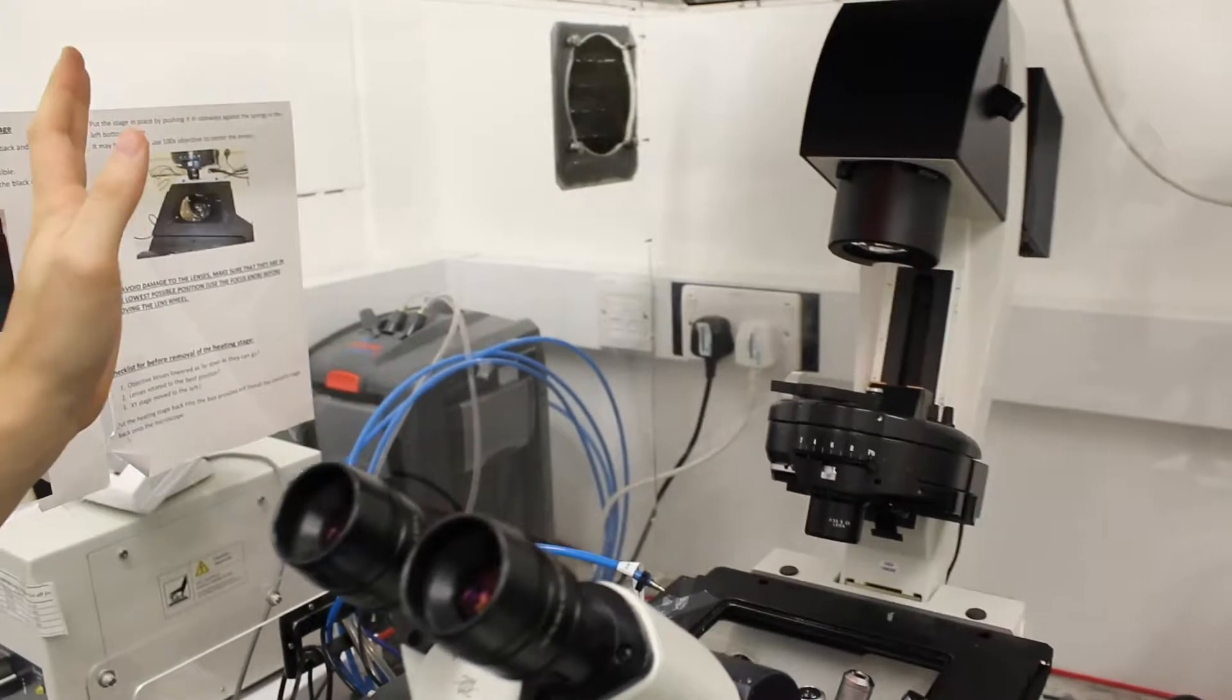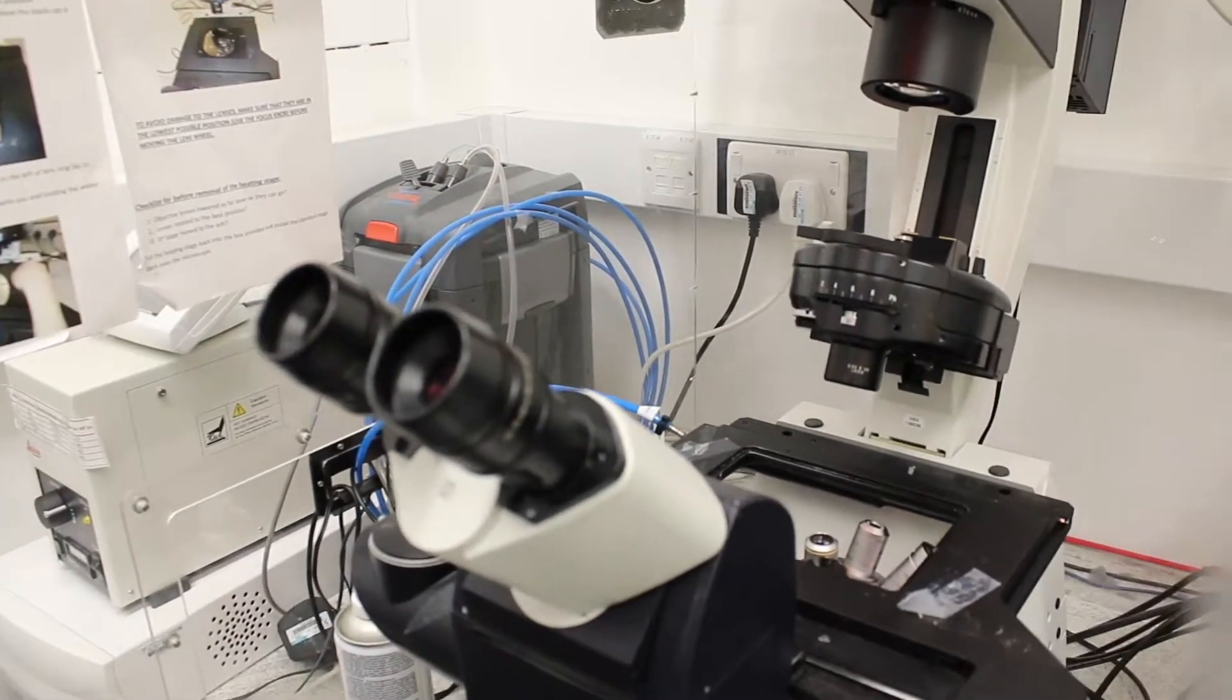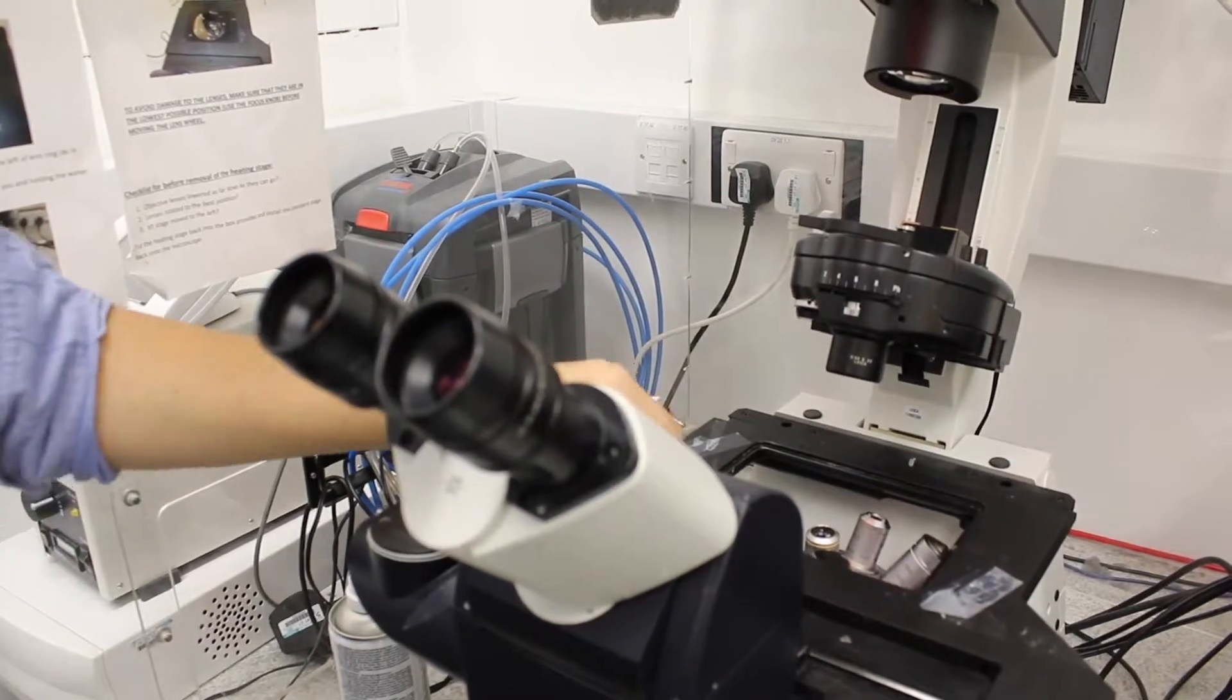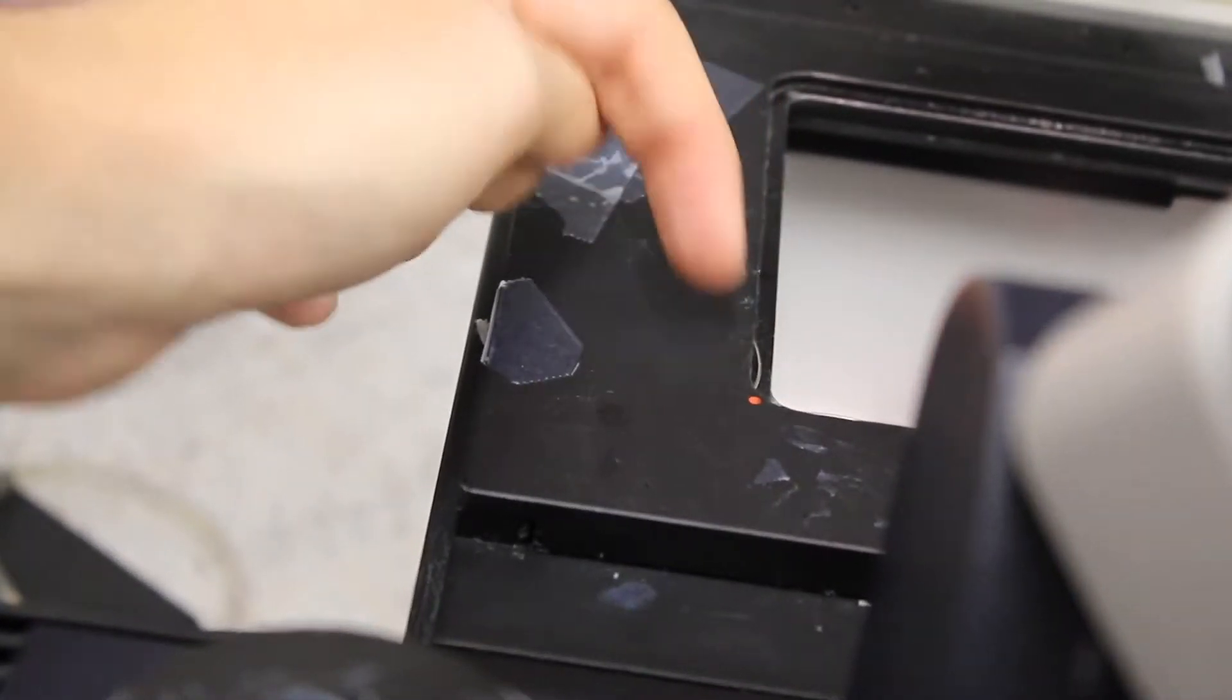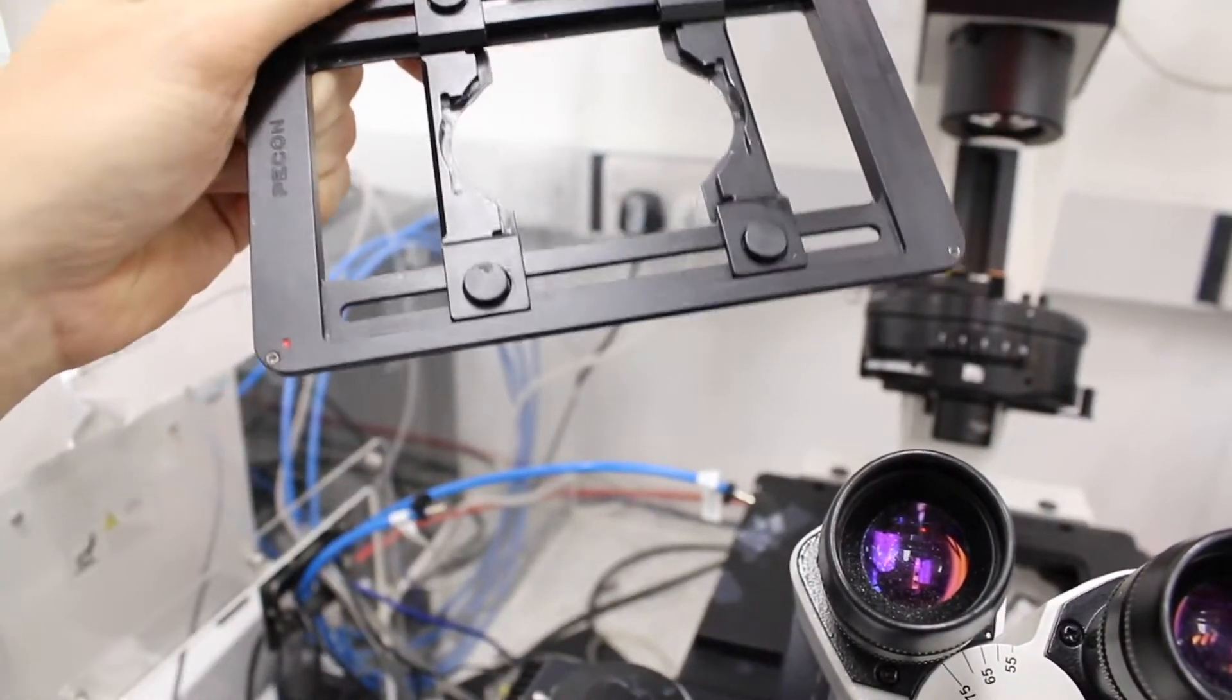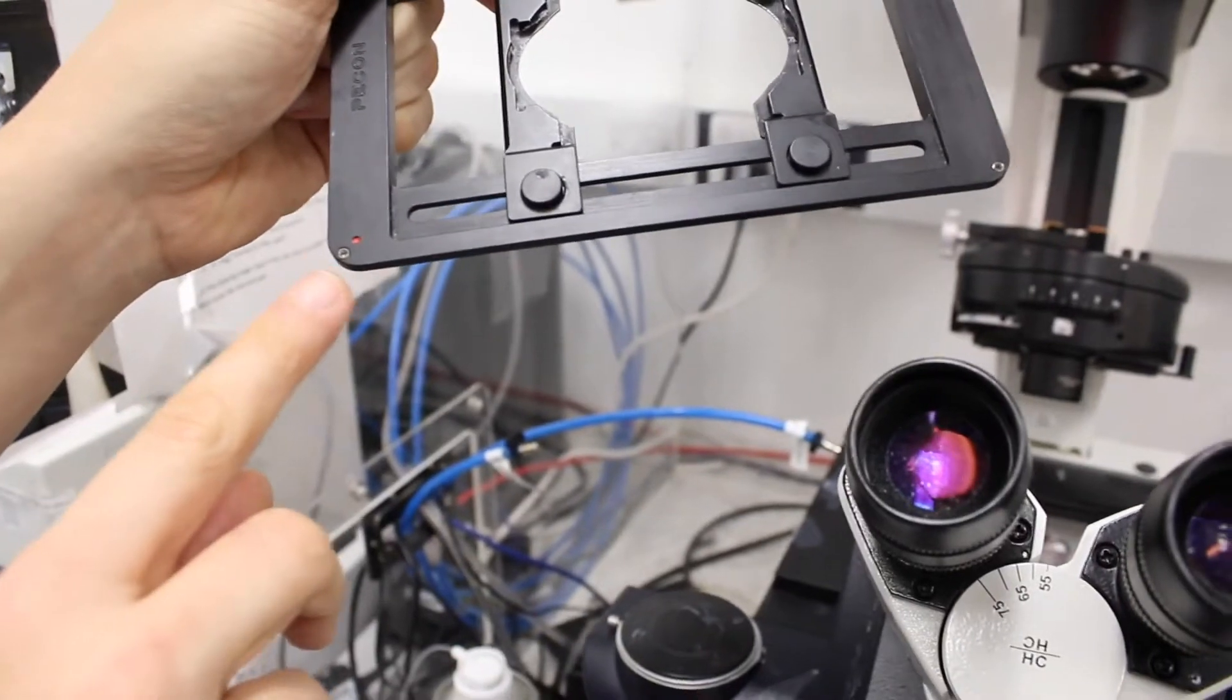And then you will see that there is a small red dot here. This red dot and there are two small springs. On this one you also have a red dot here. On the other one there are no red dots, so it doesn't really matter the order you're putting them. But basically you have to make these two red dots pressed together.